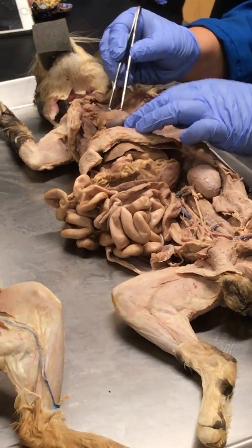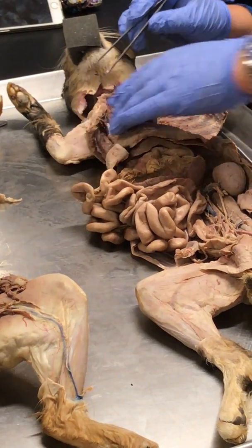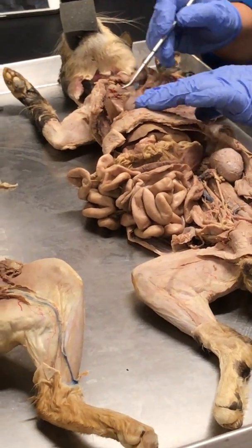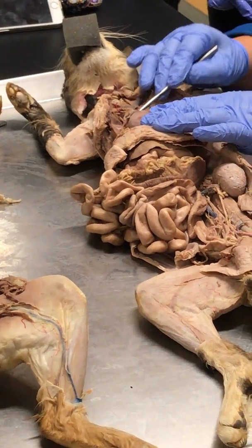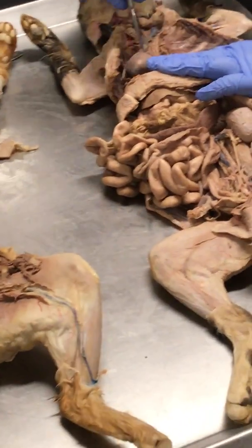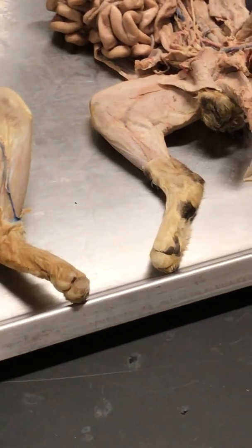You know that this sac here is called the pericardium. We remove it, you get to see this thing known as the apex of the heart, and then you have the base. Now on this side, you see this structure. This is the right auricle. That's the left auricle, right? So you see the auricles, you see the apex and base.